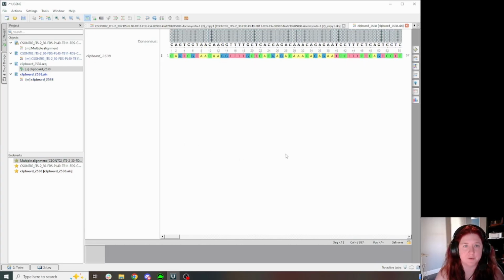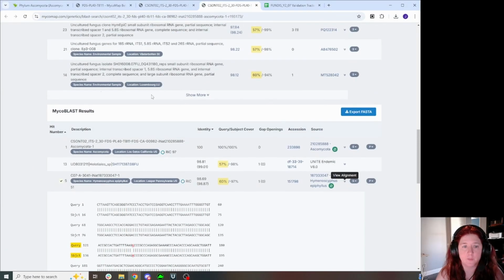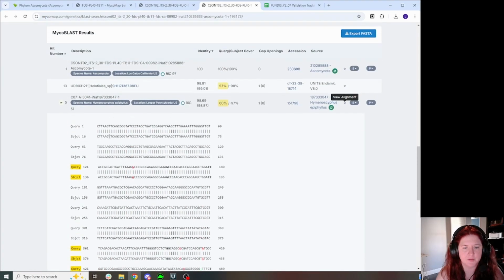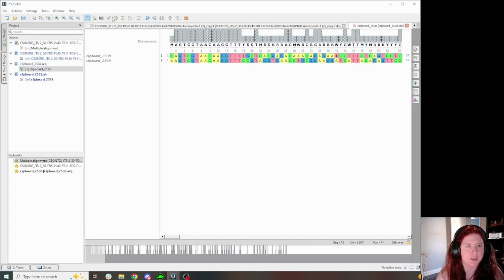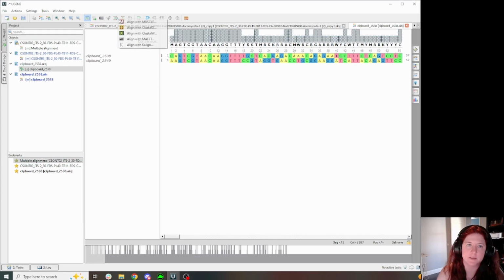So all I'm actually going to do is, this is my initial sequence that was spit out by NG species ID. Then I'm going to take one of these close ones, actually, we'll take this one. It's a fairly close Hymenoscyphus. We're going to open the accession number for that one on Mycomap, copy it, and paste that into UGENE. Then we'll align it and see how it's aligning in here.